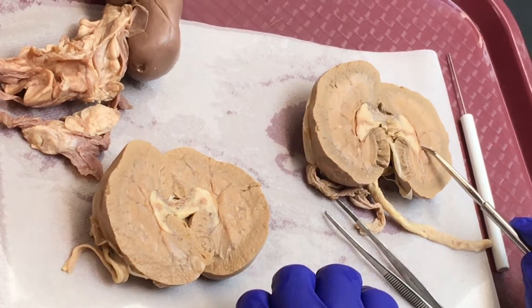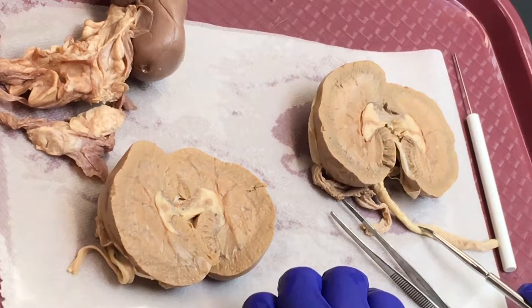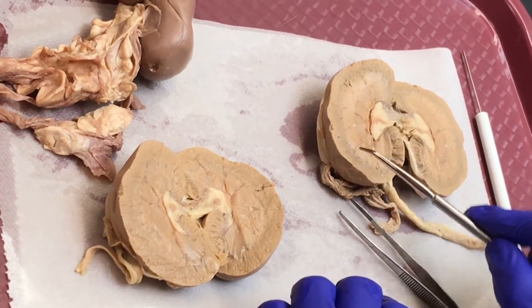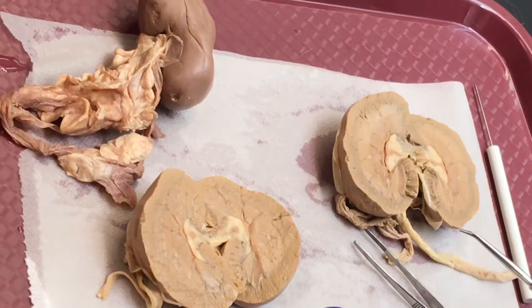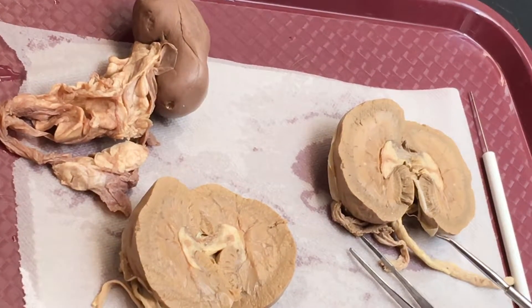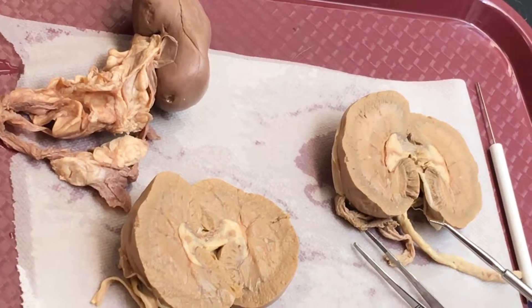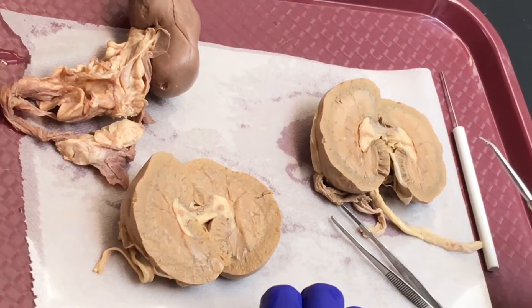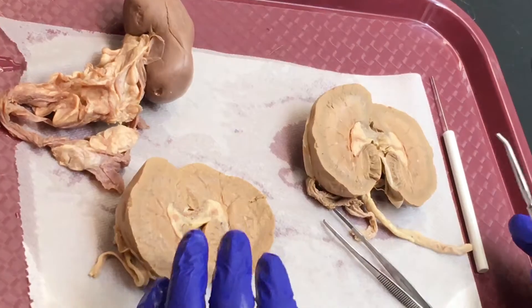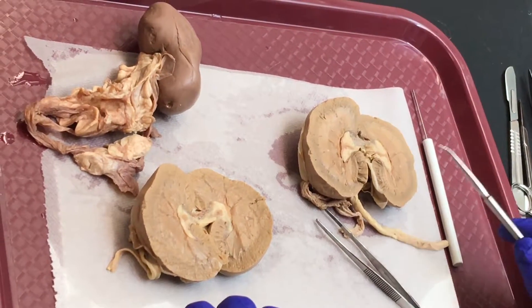The apex of the renal pyramid is called the renal papilla. The renal capsule, renal capsule, ureter — and this indent is called the renal hilus or renal hilum. They are synonymous. In your book it is written renal hilum or hilum — H-I-L-U-M or H-I-L-U-S.